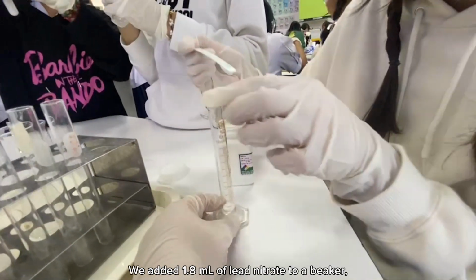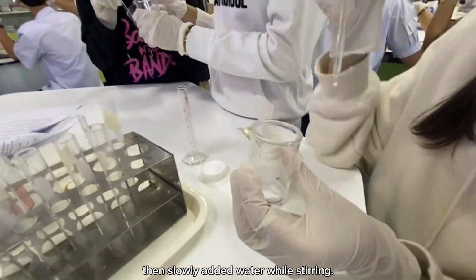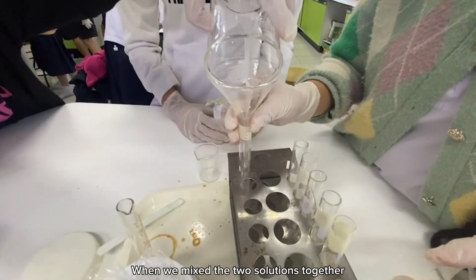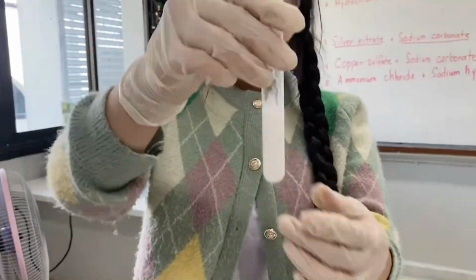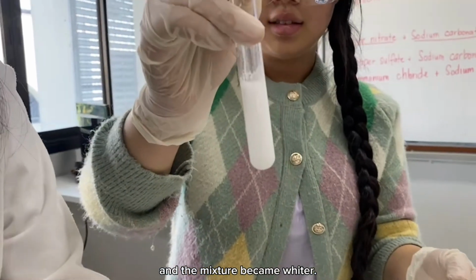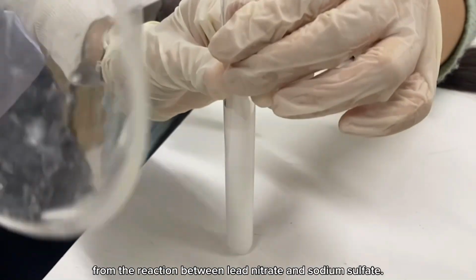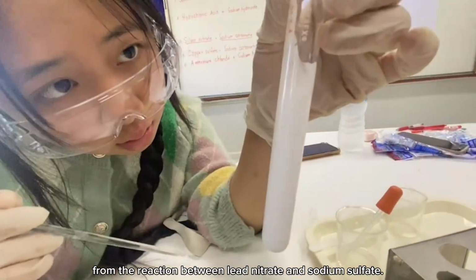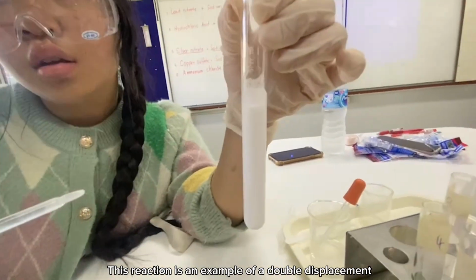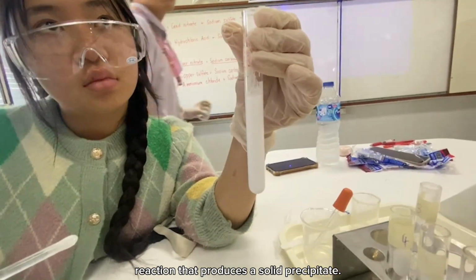We added 1.8 milliliters of lead nitrate to a beaker, then slowly added water while stirring. The same was done with sodium sulfate. When we mixed the two solutions together, we observed the formation of distinct layers, and the mixture became whiter. In this experiment, we observed the formation of lead sulfate from the reaction between lead nitrate and sodium sulfate. This reaction is an example of a double displacement reaction that produces a solid precipitate.